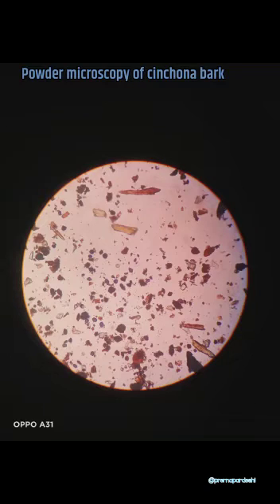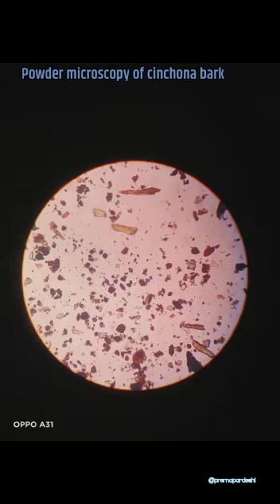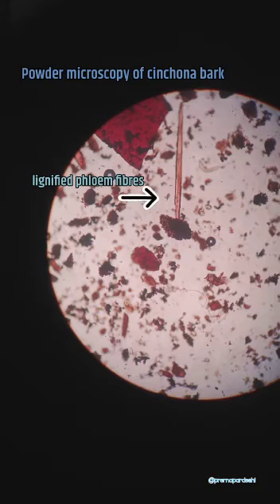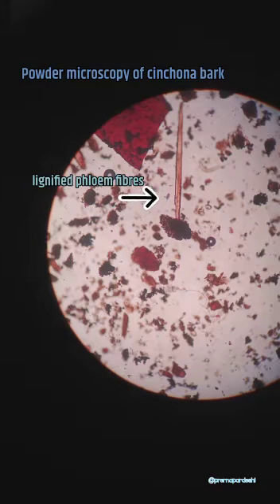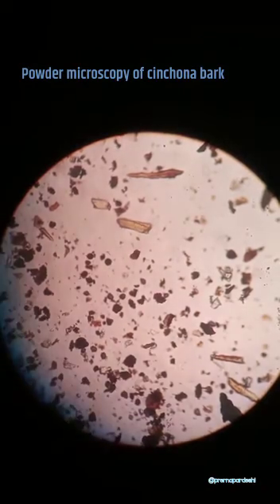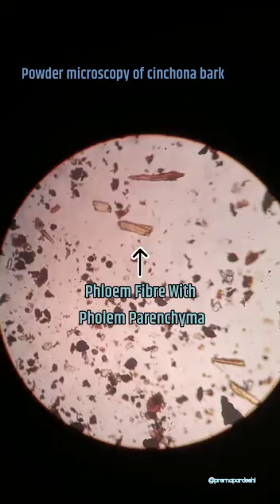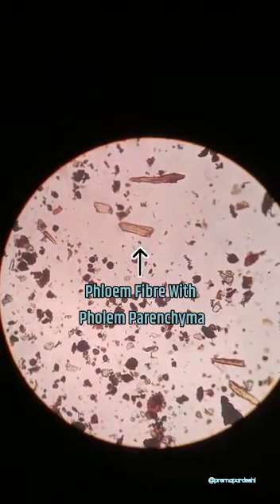This is the powder microscopy of cinchona bark. This thread-like structure is lignified phloem fibers, and these are the phloem fibers with the phloem parenchyma.